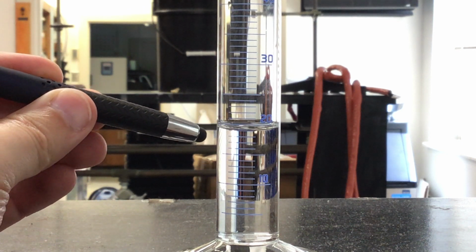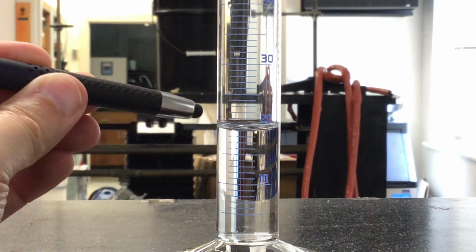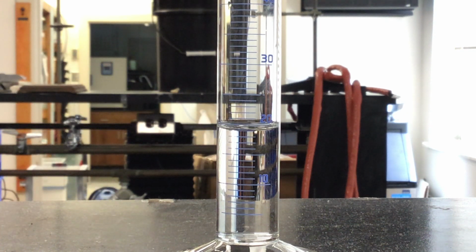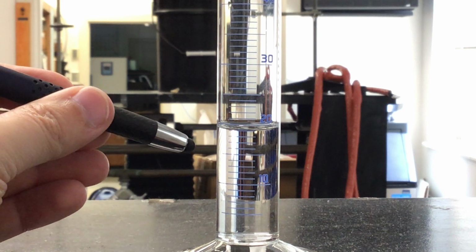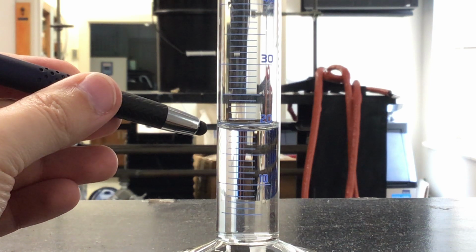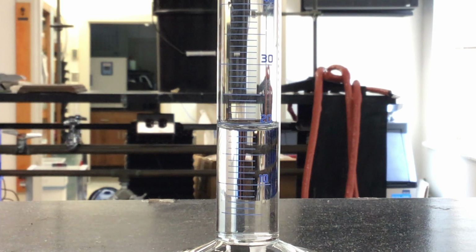We're going to read the very bottom of that U shape, which you see like the bottom of this line, and that's where we make our actual measurement. If I look at the tick marks of where that falls, starting up here, it looks like about 15, 16, 17, 18. It's awfully close to 19 milliliters. And again, the last decimal place has some kind of variation to it.